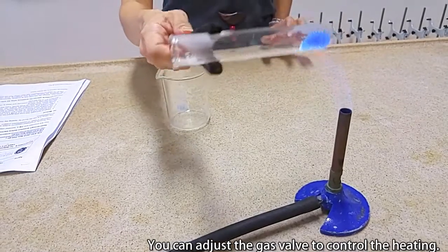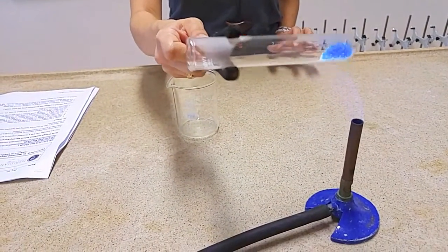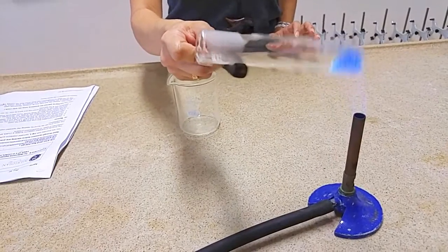You'll see that at the bottom, it'll start to be a bit white. That's the part where the solids are without the water.